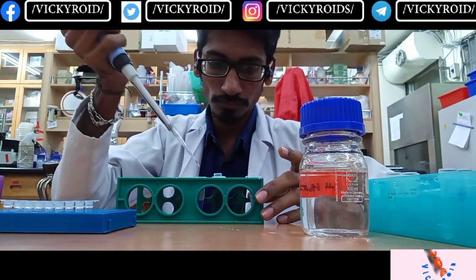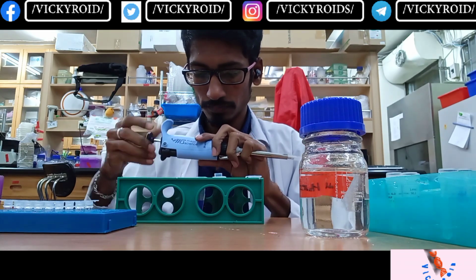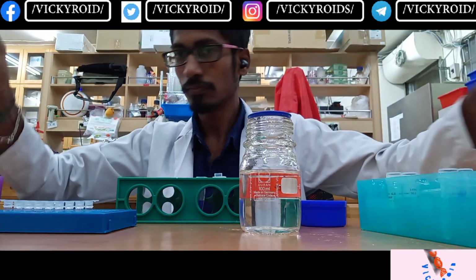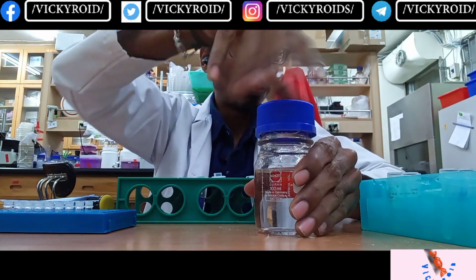I'll be adding 6 microliter of water for each sample, so totally 17 times 6, you will have 102 microliter of water. So I have added the water.